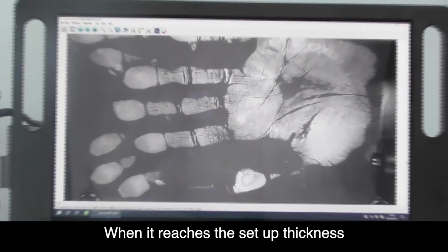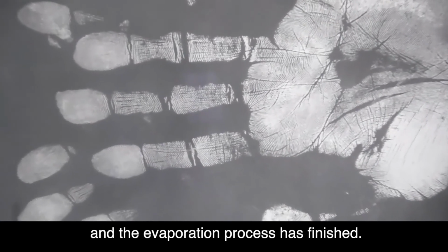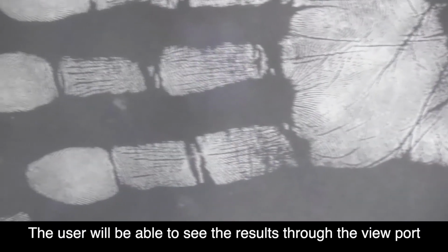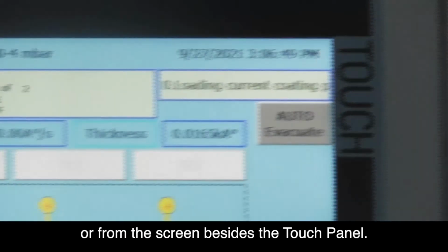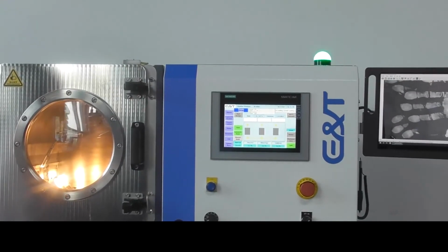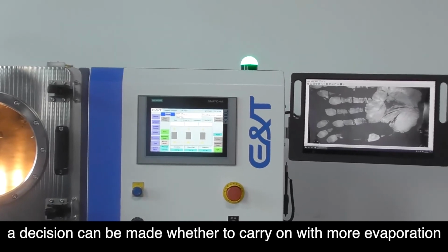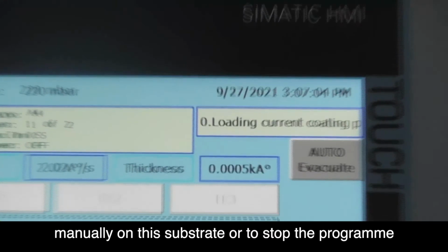When it reaches the setup thickness, the shutter closes automatically and the evaporation process has finished. The user will be able to see the results through the viewport or from the screen besides the touch panel. The user will have a better view with more details from the screen. At this point, a decision can be made to carry on with more evaporation manually on this substrate or to stop the program.